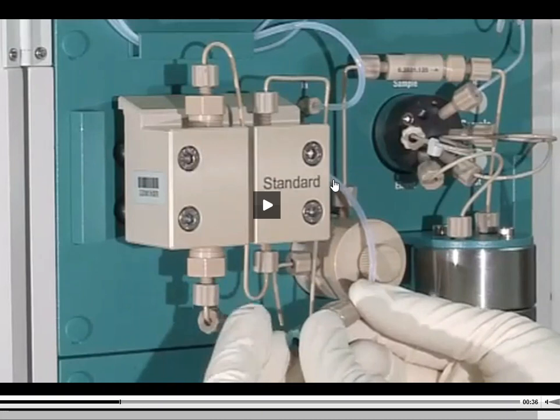This eluent, it's coming from this clear piece of tubing that's right here, okay? So the eluent's going to be coming in this way, and what we want to do is make sure that this eluent stops. What you're seeing is that there's a cap being placed onto that piece of tubing, and the reason the cap is getting placed onto there is if I just let this thing flow with no cap, this mobile phase is basically going to get sucked through that tubing line.